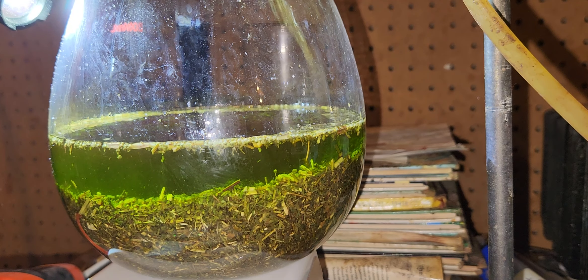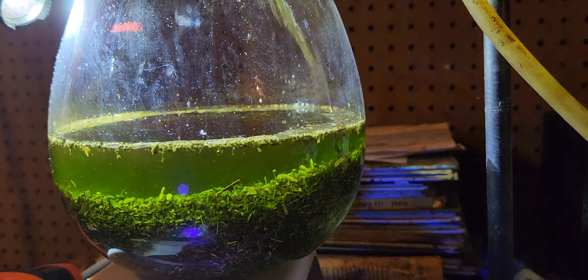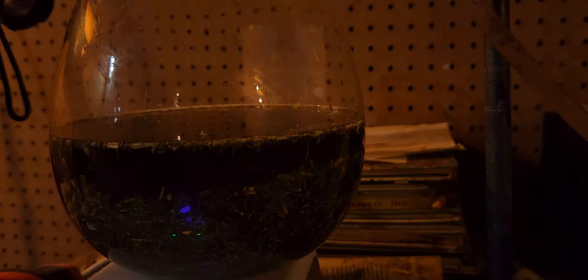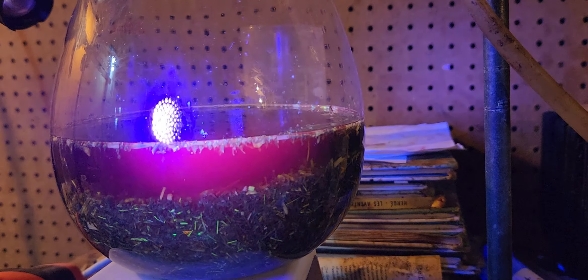This green color is probably from the chlorophyll, because the UV light turned it red, pinkish. So if I do this again you can see it turns sort of pinkish. If I turn off the flash again you can see it works quite well — I fire it at it and you can see it works very well.